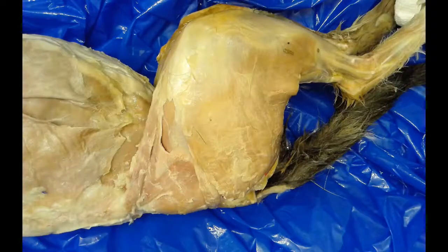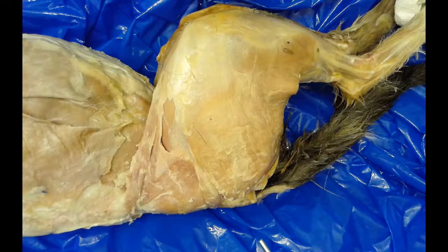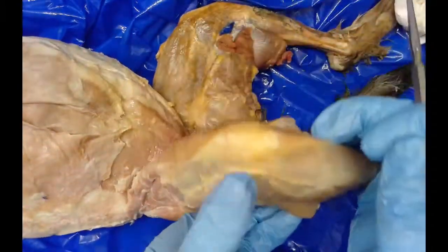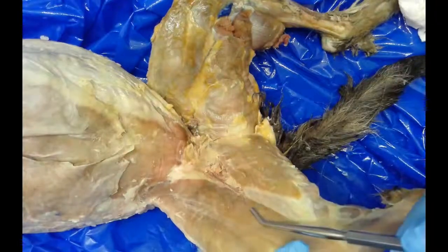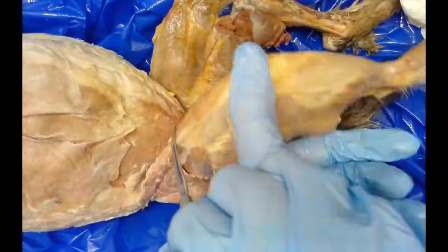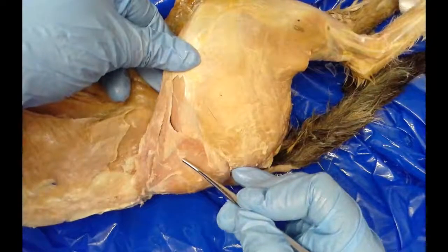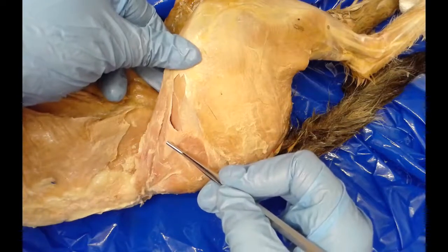The last area we're going to look at is the rear limb. The first muscle is the sartorius muscle — a thin muscle on top of the thigh. But if we flip the leg over to see the inner part, it's actually a huge muscle making up the bulk of the inner thigh. You can see it on the inner thigh as well as the top of the thigh. We also have a fan-shaped muscle called the tensor fascia latae, which is part of the side of the leg and helps to abduct or rotate the thigh.